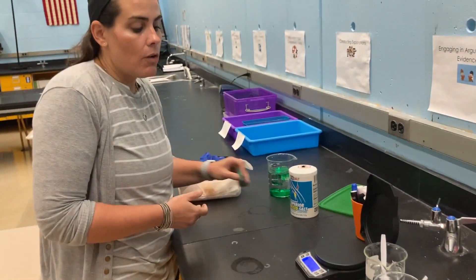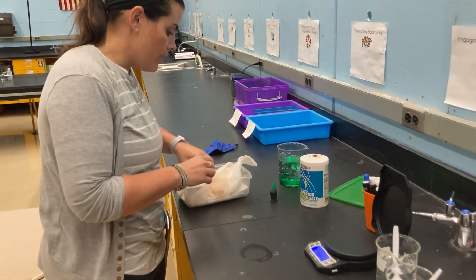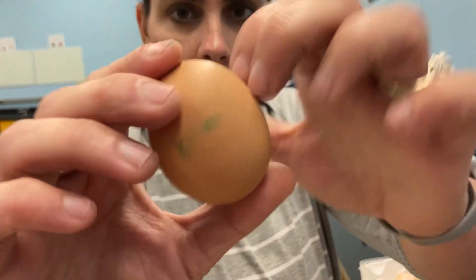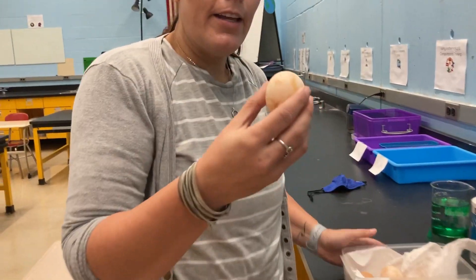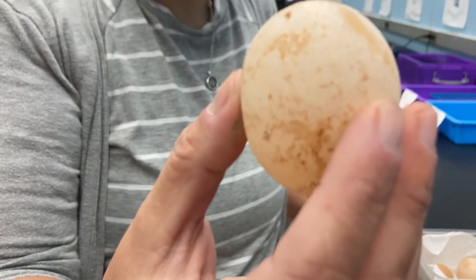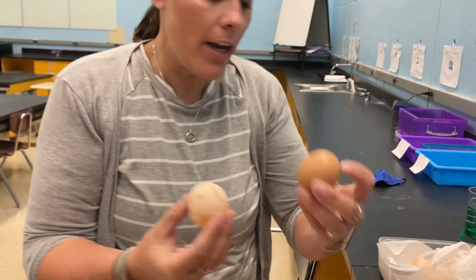A great model of how substances move across a cell membrane is to use an egg. We're all used to regular eggs with that hard shell. You can hear my fingernails hitting that hard shell. What you can do is put an egg in vinegar — the vinegar is an acid and it will react with the calcium shell of the egg and dissolve that hard shell.